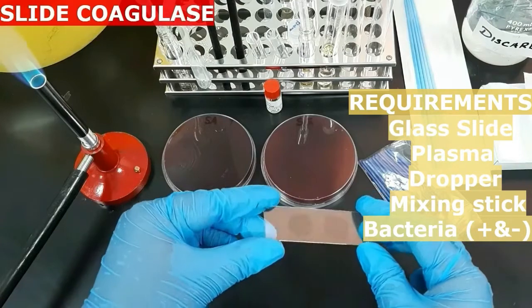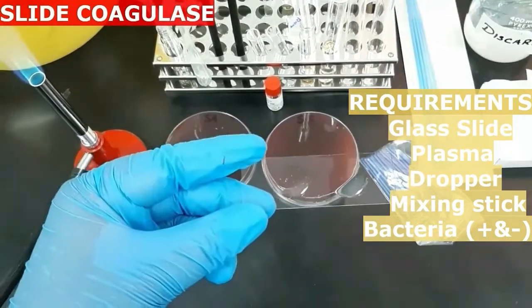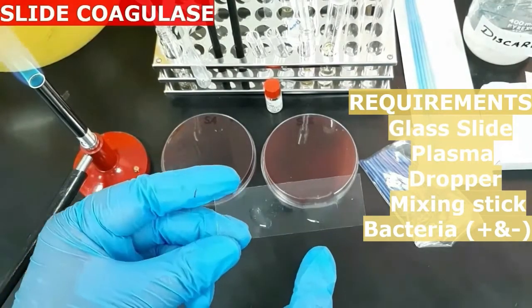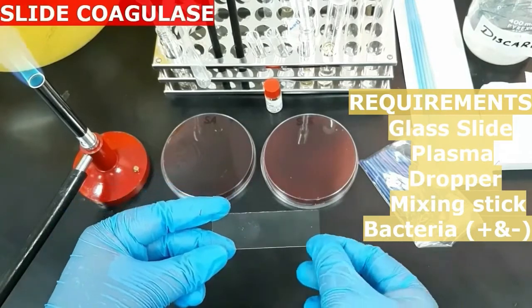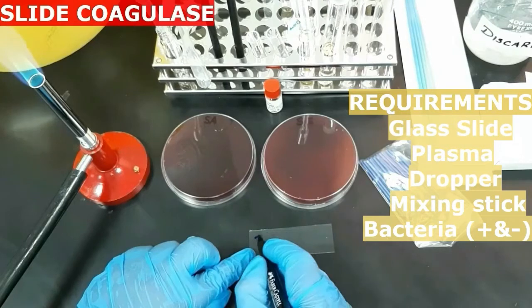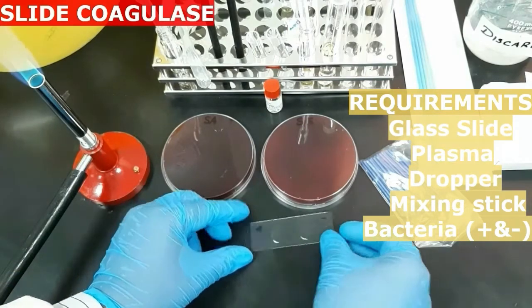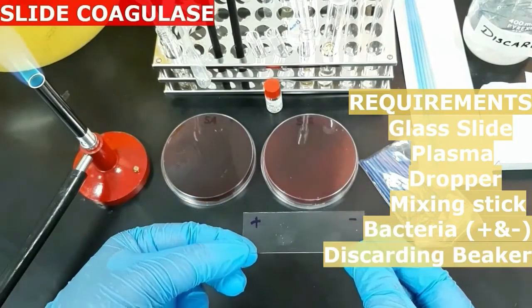A positive reaction can show clumps within 5 to 10 seconds. So here you can see the formation of clumps in the positive control and no clumps in the negative control sample. Once you finish the test, discard the slide in the discarding beaker.